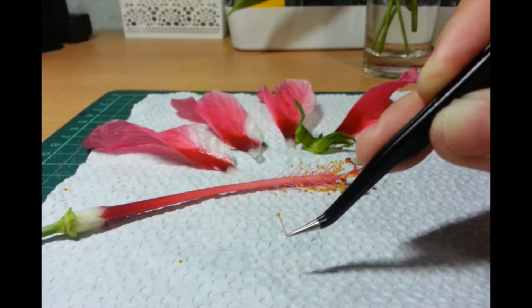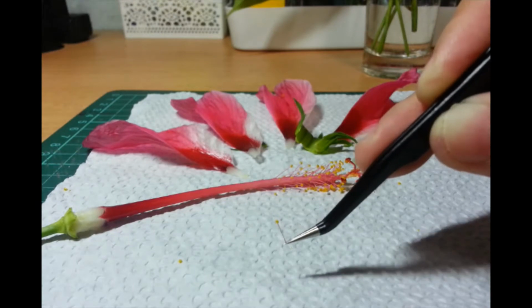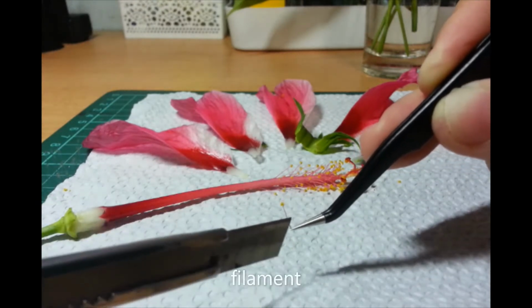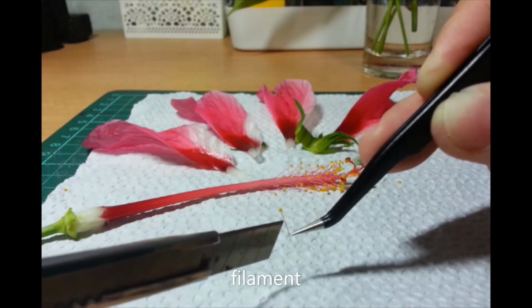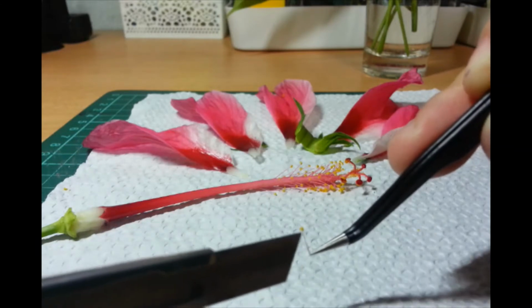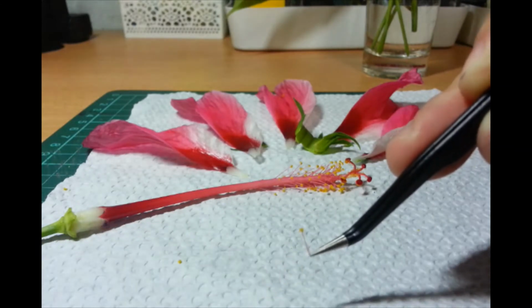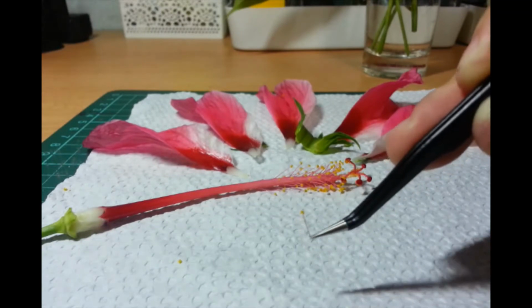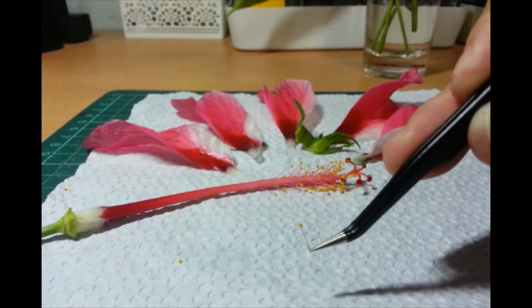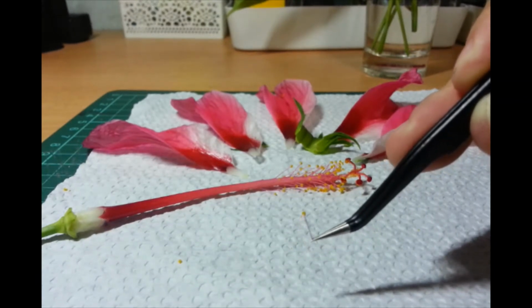So, we have here a stamen. The stalk-like structure is called the filament. So, this attaches it to the rest of the flower. And this yellow thing here, yung parang head. Diba? Parang siyang pin. Right? So, the elongated part is the stalk. It's called the filament. And then the head part there, parang yung head ng pin, is the anther.